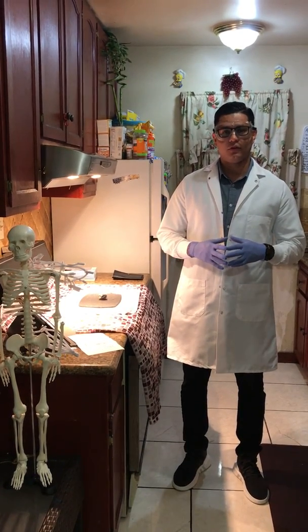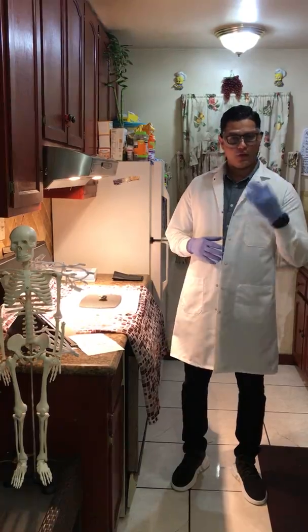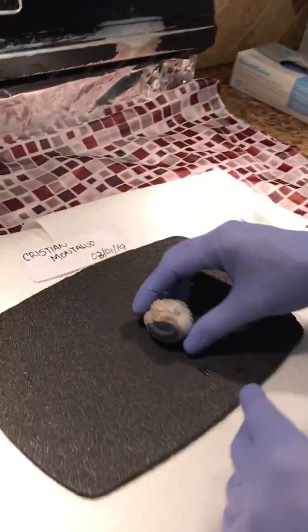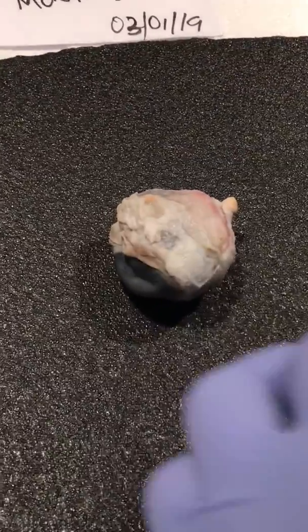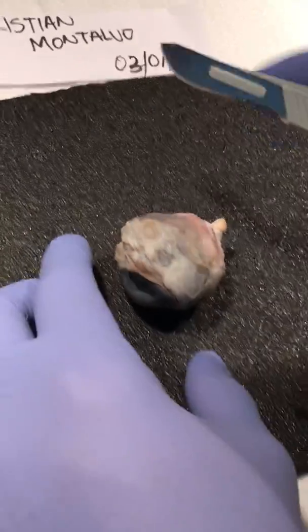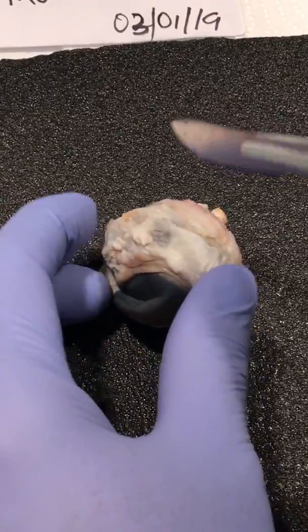This is our last video, and we're going to be studying today the structure of the eyeball. I want you guys to get close to me and see the structure of the eye. We're going to start by dissecting the eye, and we're going to do a frontal plane incision right now.